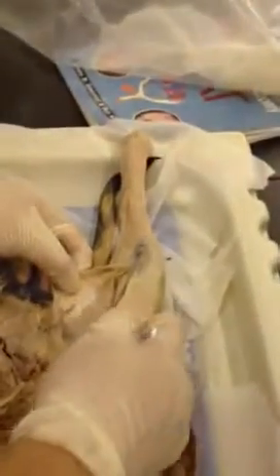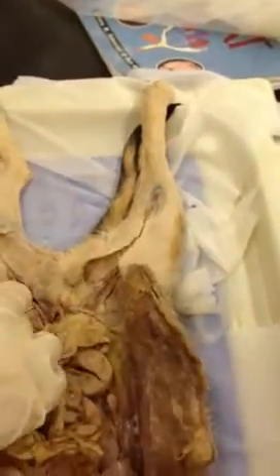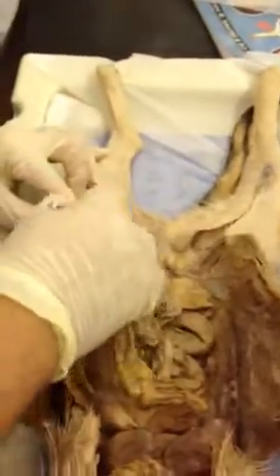And then we kind of lose it again, so we get to the legs, and again we're looking at the femoral coming down here. And let's go take a look at this. Now skip this cat. I haven't seen this one yet. Let's go this cat.